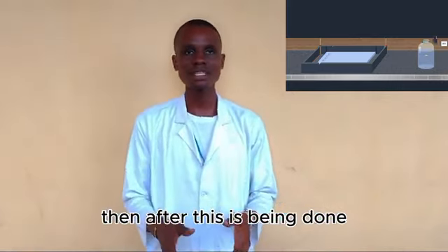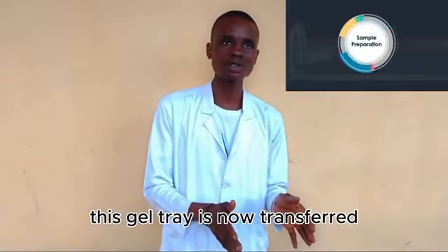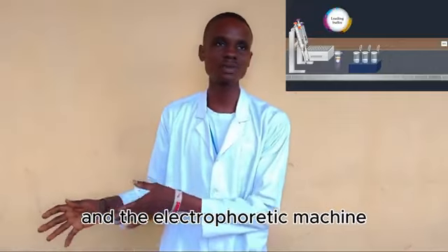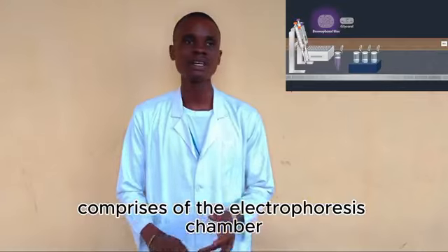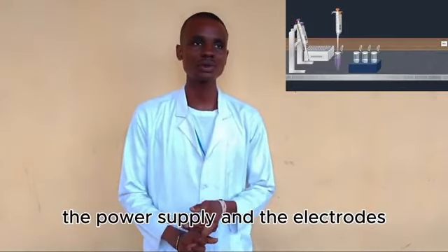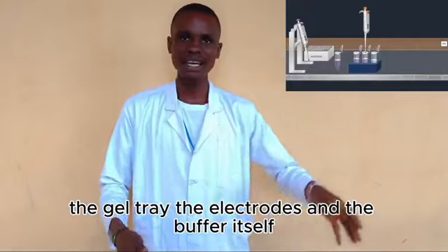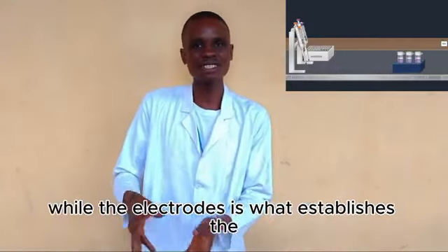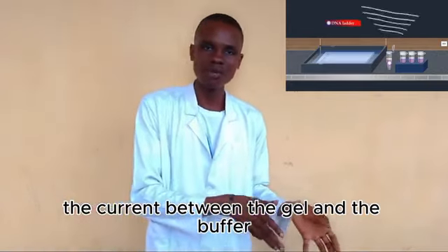After solidification takes place, the gel tray is transferred to the electrophoretic machine, which comprises the electrophoresis chamber, the power supply, and the electrodes. The electrophoresis chamber contains the gel tray, the electrodes, and the buffer itself, while the electrodes establish the current between the gel and the buffer.